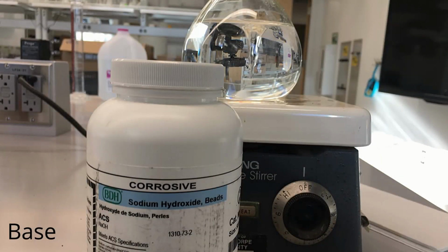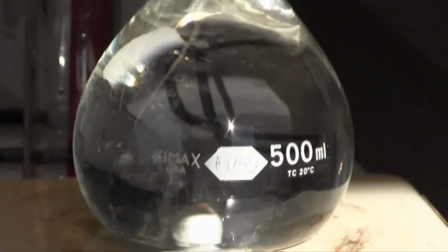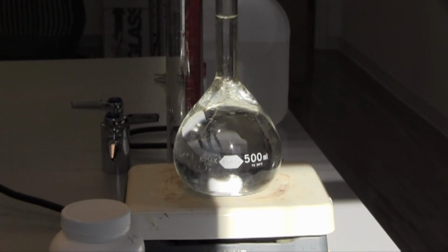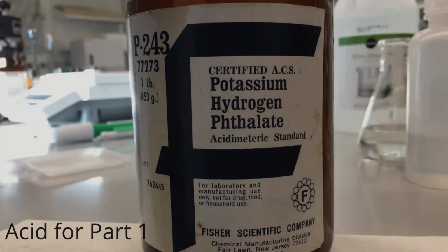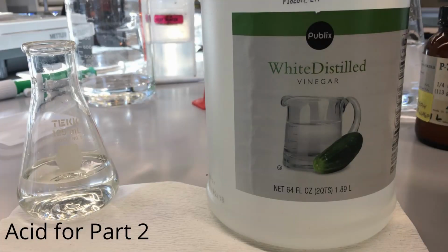In addition, we have our base, which is sodium hydroxide, you see here, and that will be about 0.1 molar or 0.1 moles per liter. We make a solution by taking 0.1 moles of NaOH and dissolving it in about 1 liter of water. Our acid will be the KHP or potassium hydrogen phthalate, and that is shown here in solid form. And in addition, our secondary acid will be our Publix brand vinegar right here.